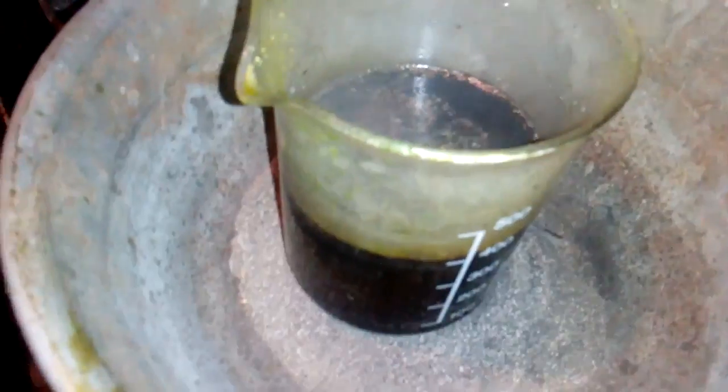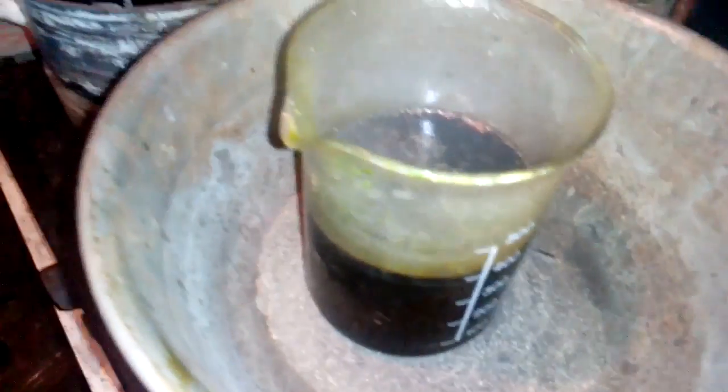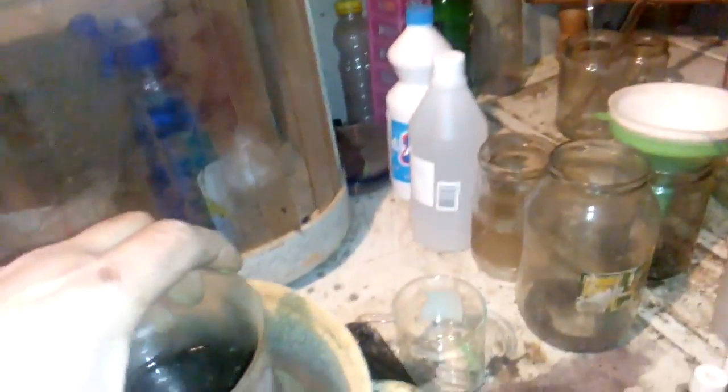Okay, this is our first batch. Third batch, and we still got reaction. Okay guys, this is our last batch. There's not much pins inside. See this, just a little sand down. I put inside two filters from the filtering of the previous four batches, and this is our solution from the last four batches.